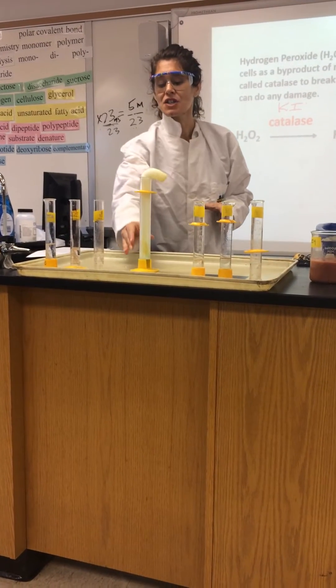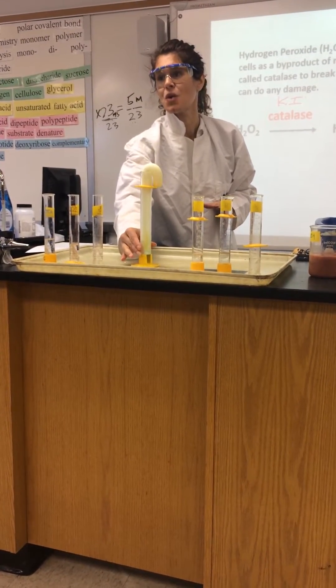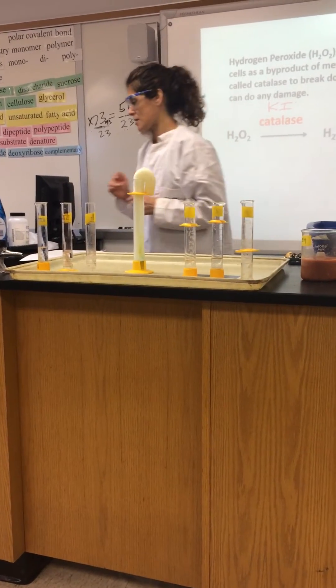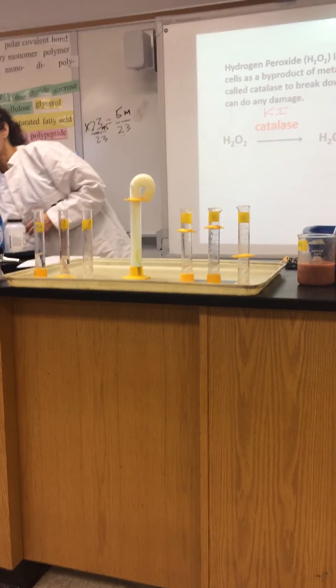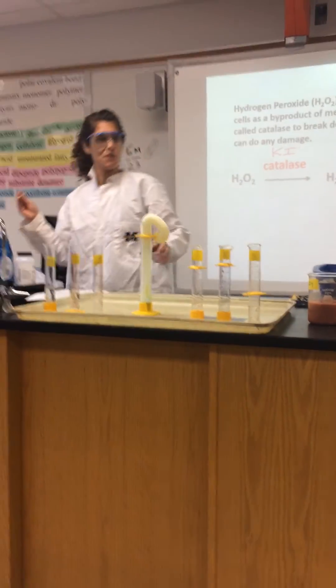If you touched this, you would feel that it's actually quite hot, so it's an exothermic reaction — which is not really something that we are testing you on.